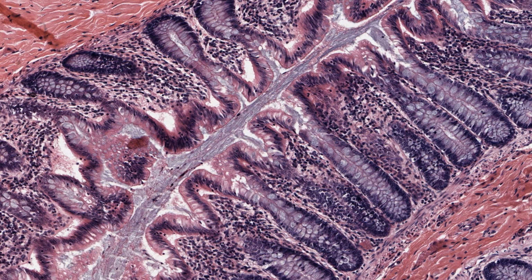A basal lamina, which you cannot see, surrounds each gland and separates its epithelial cells from the surrounding connective tissue or lamina propria. An elongated structure, such as a gland, will appear quite differently when cut in different orientations. It's always important to find areas with the simplest plane of section for your study.